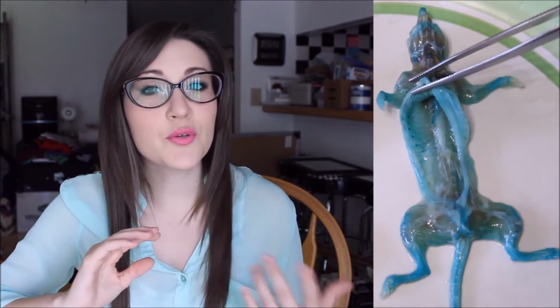As you can see, the mouse on the left is more brown, and you can't really see the bones too well, and it isn't too transparent. The mouse on the right, however, is very transparent. It's more like a clouded transparency. And you can see where the cartilage stain is on the specimen. You can also visibly see the spine very well. So there is a humongous difference between the mouse on the left and the mouse on the right.